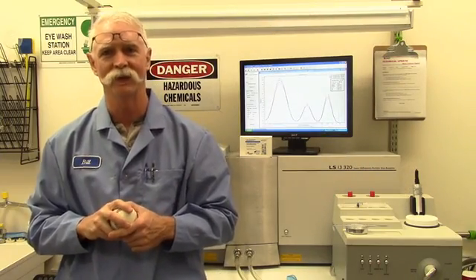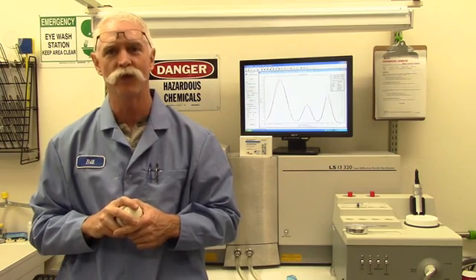Hi, this is Bill Barrs from the Applications Lab with another segment of the LS13320 How-To Video Series. Today's topic of discussion is going to be sample preparation.